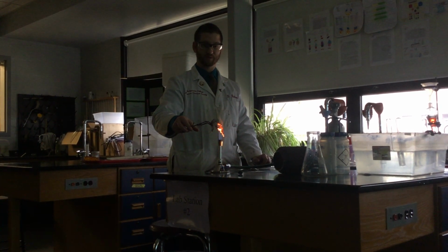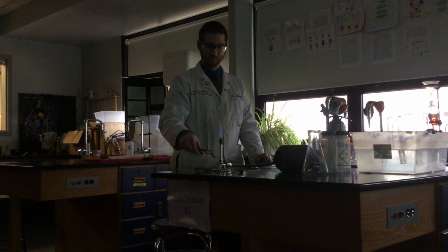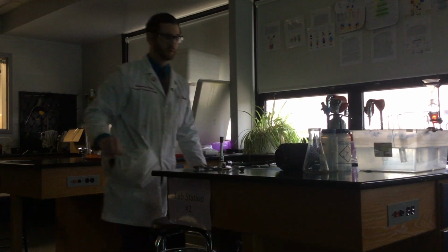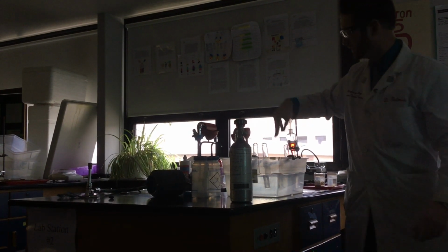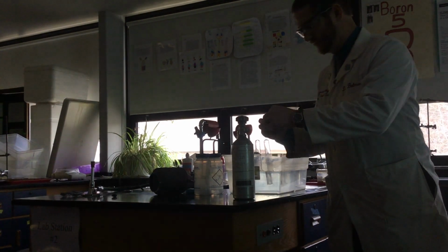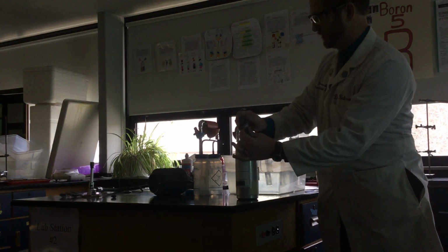How about that? Again, we weren't lying when we took the last slide worth of notes. But what if we could somehow get even more oxygen present? So let's go ahead and try it. I'm just going to leave this burning over here. In this tank here, I have oxygen. So I'm going to basically make a gas collection tube. I'm going to take this flask, put it upside down in water. Rather than putting the tank underwater, what I'm going to do is just fill a balloon with oxygen, bubble that up through.